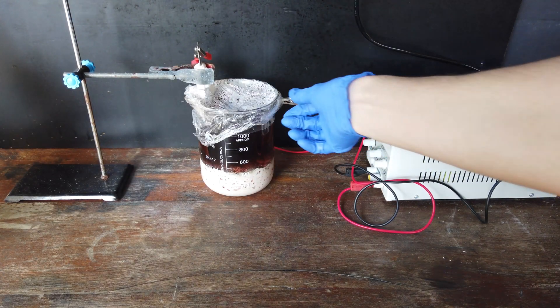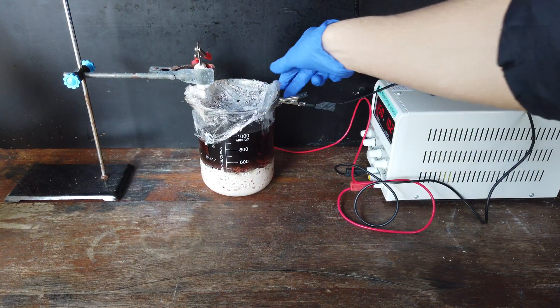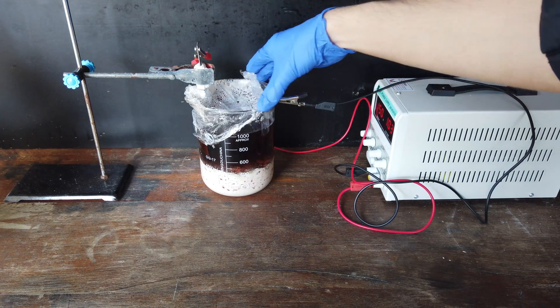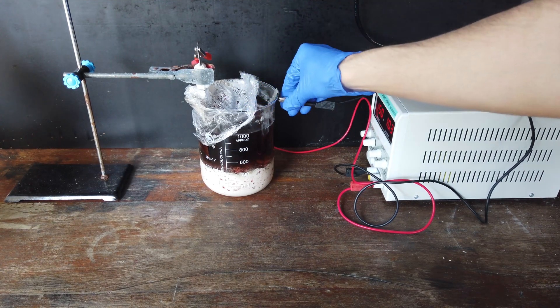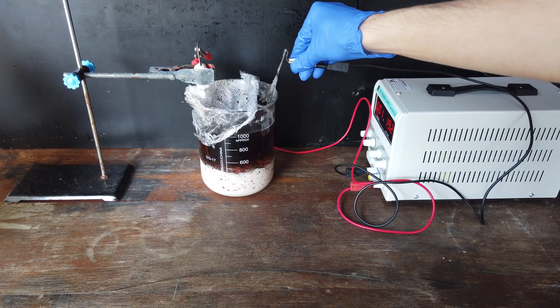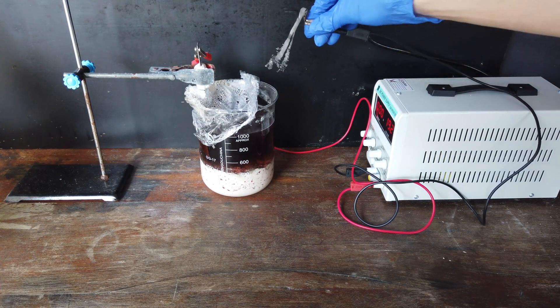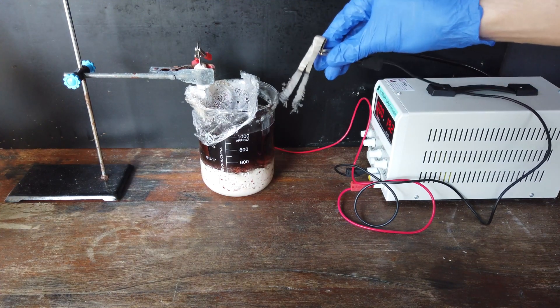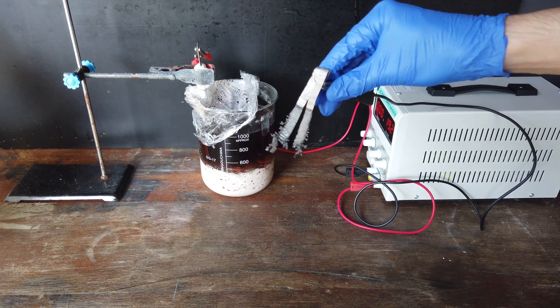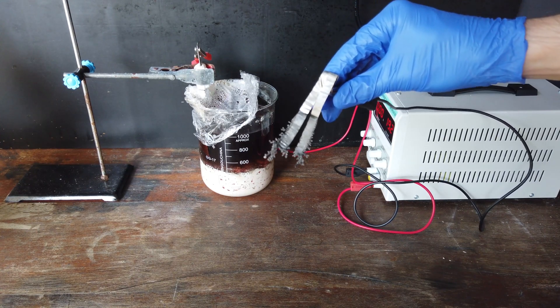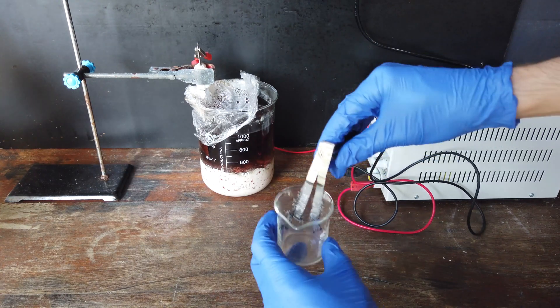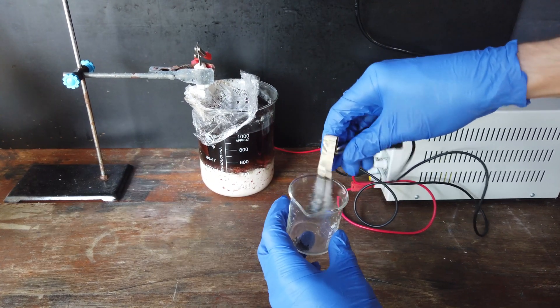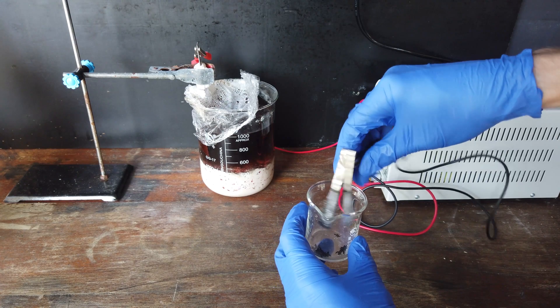Alrighty. One day in, we'll get another look at the cathode now. You can see we have quite a bit of cobalt and nickel growing on the cathode there. It's not very well adhered and it's very dendritic. And it will really come off really easily. So, I'm going to start putting most of this into a beaker.